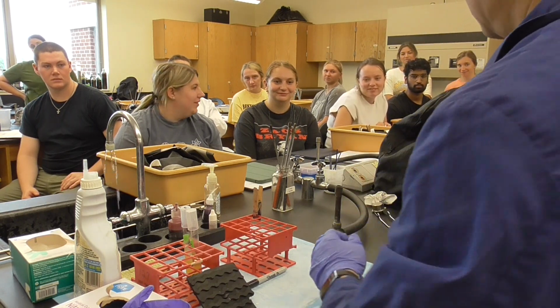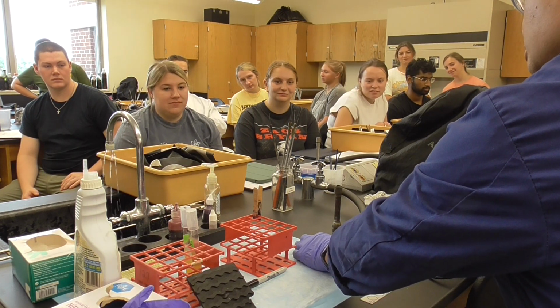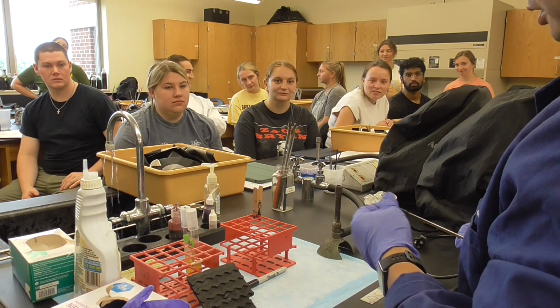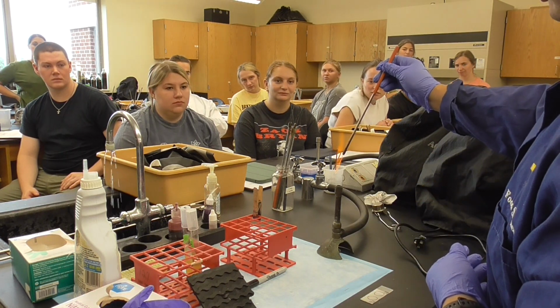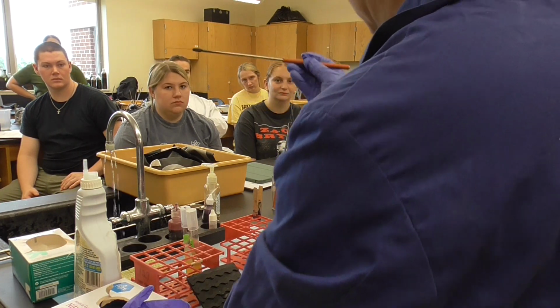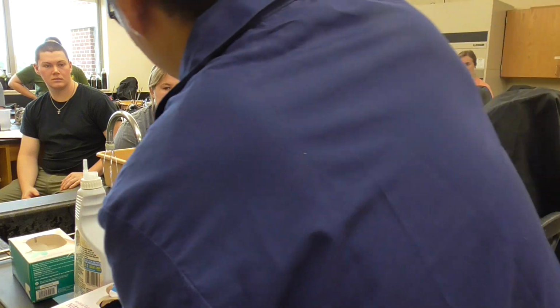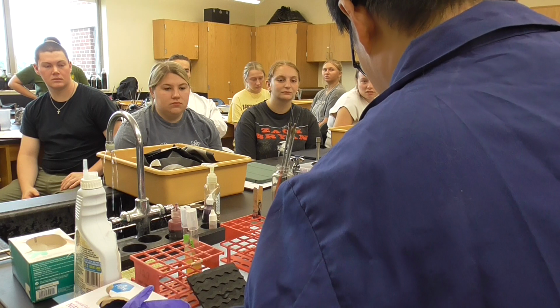Okay. Let's turn it on. So this could be adjusted, large or small, just like that. Okay. Be careful, it's dangerous. Now this one, make sure it's flat and burn it first. We see the red, which means it's already sterilized. And this part is dangerous, so it has to be avoided. I'll just grab some water. So one drop of the water right here, another drop of the water right here. Okay, 2 drops of the water.